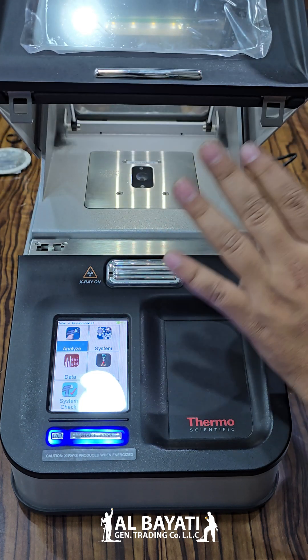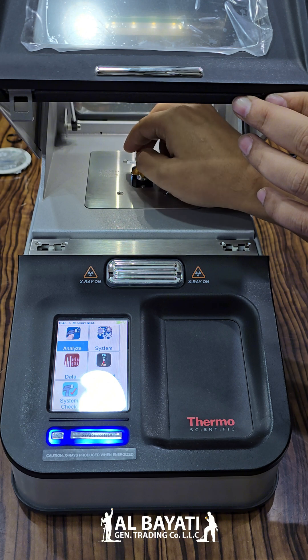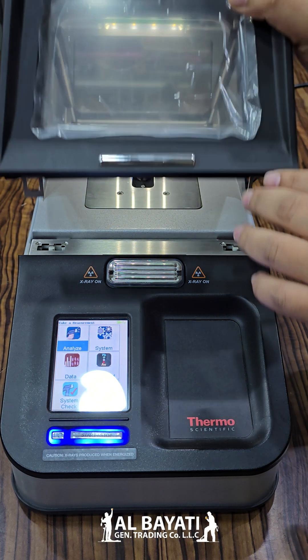Open this one. After you have any metal, you put it in the middle. And close.